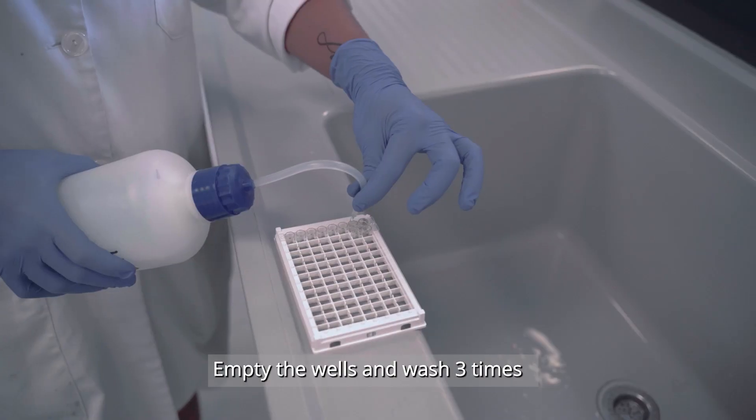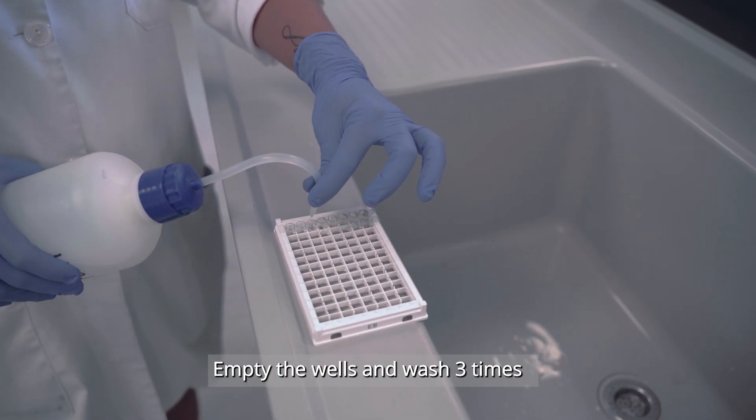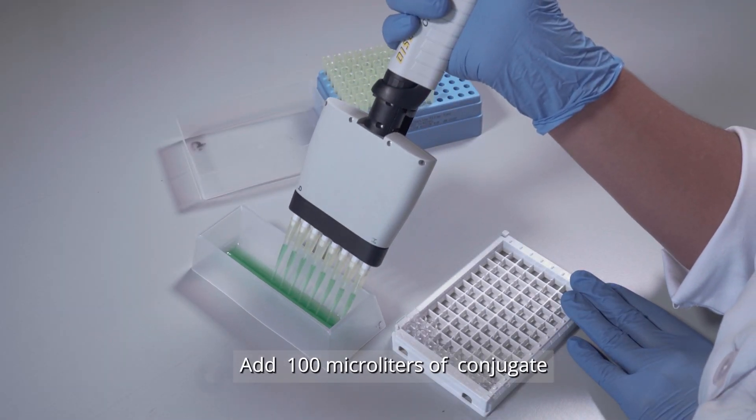Empty the plate and repeat the washing step three times. Add 100 microliters of conjugate.